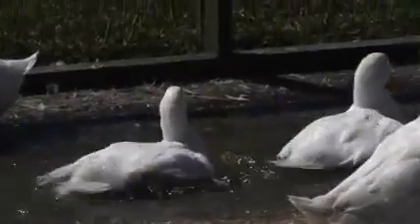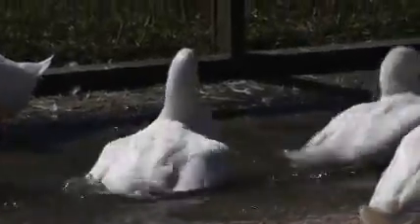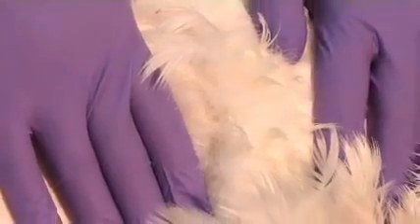Compared to other poultry species, the feathers of ducks are very densely packed together, providing insulation against water and facilitating swimming. Examining the skin and subcutaneous tissues of ducks takes some extra effort, but is a very important part of the exam. Be on the lookout for skin lesions or masses.